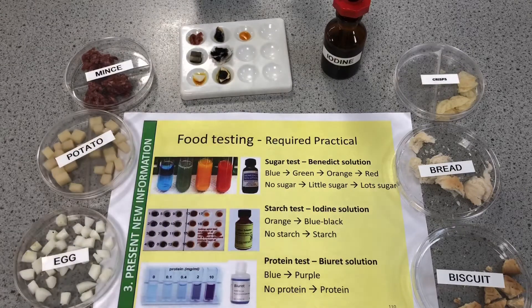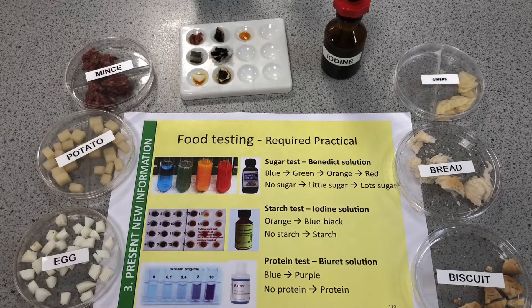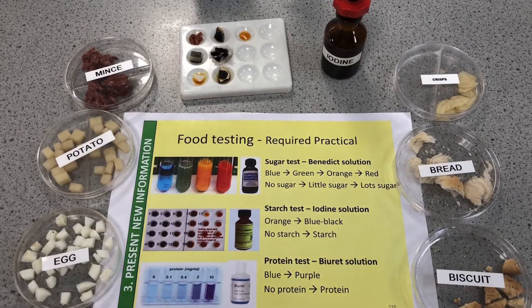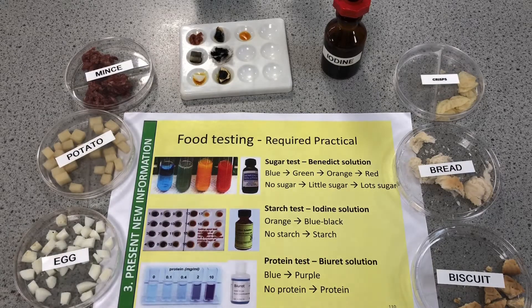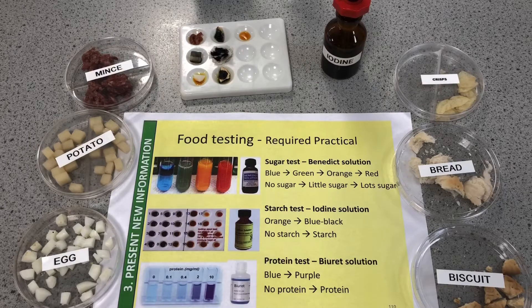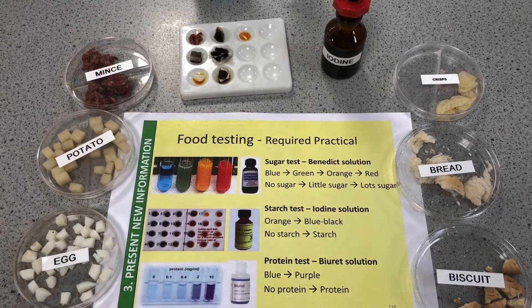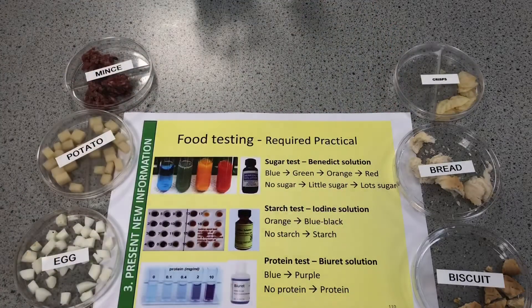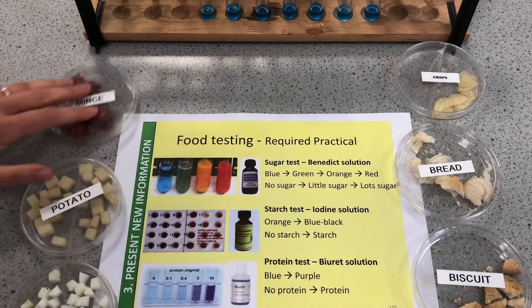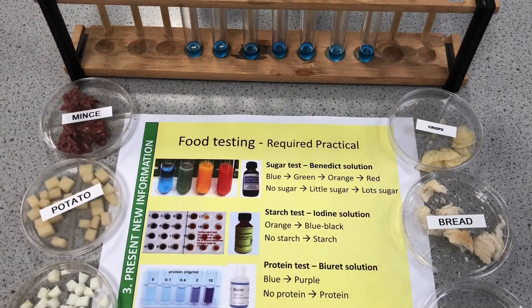We can see the Benedict's is starting to get a small color change on the biscuit, which is good. Reviewing the iodine results to put on our results table: the meat — no starch; potato — starch; egg white — no starch; crisp, bread, and biscuit — all containing starch. For iodine, say 'remains orange' rather than 'stays the same color,' because saying it stays the same might make it look like you don't know the original color.